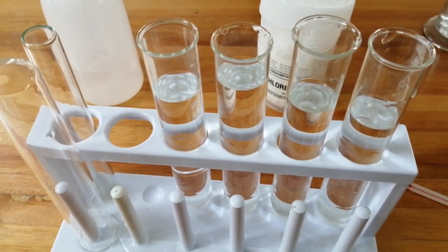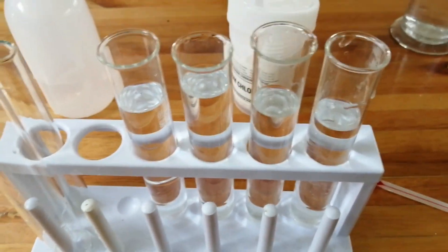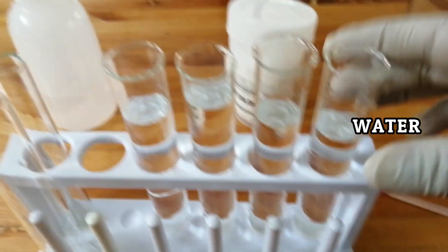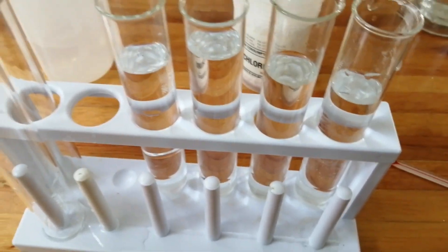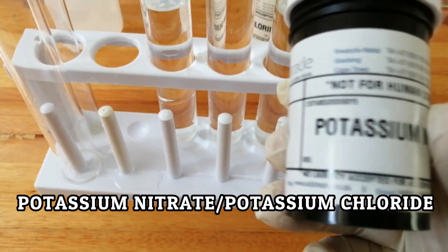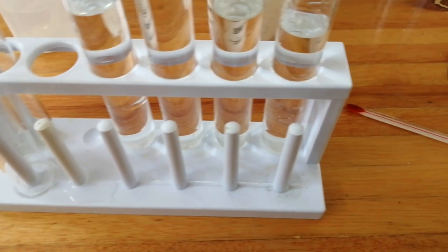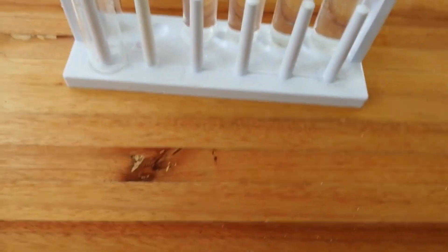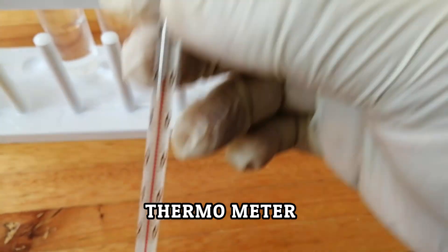Exothermic and endothermic reactions are everywhere — they are very common reactions. For the endothermic reaction, I choose two reactants: one is the universal solvent, water, and the other one is potassium nitrate. Let's see what happens when potassium nitrate dissolves in water. I use a thermometer to check the temperature of the water.